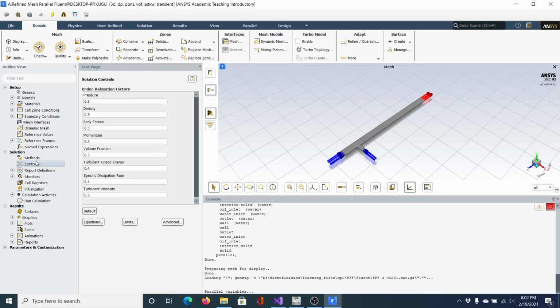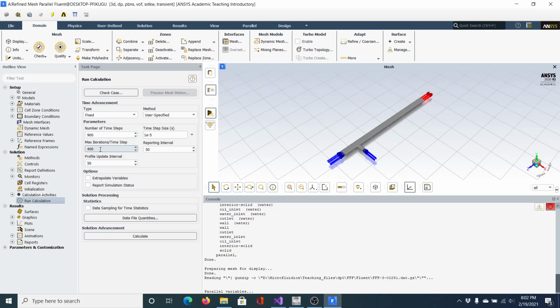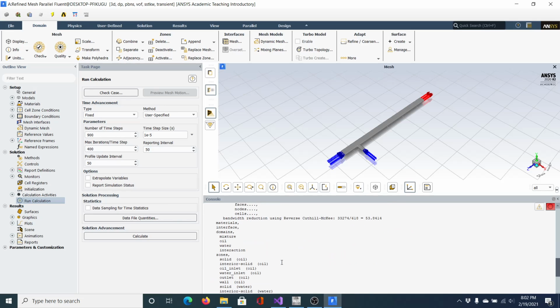You're also going to see that if we go back into here, the maximum iterations per time step I had to up to 400 because the solutions were not converging. So you'll see, when things pop up, iteration 50, 100, 150. Ideally, before you get to the maximum iterations, you want to see a little exclamation point and see that it says solution is converged. That's letting you know that at that time step the equations have run enough iterations that it doesn't have to run any more. If you're not seeing it say converged and it's moving on to the next time step, it means that you need to increase this number. The problem with that, of course, is it takes a lot longer.